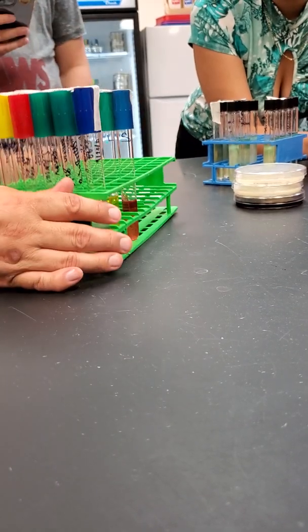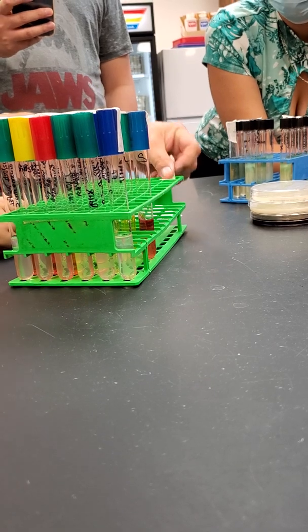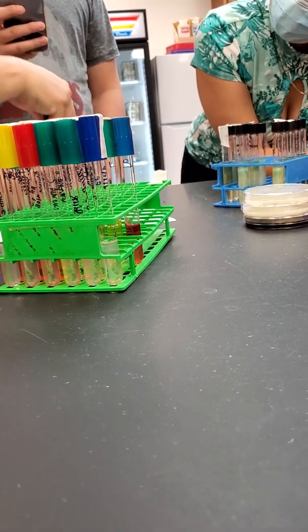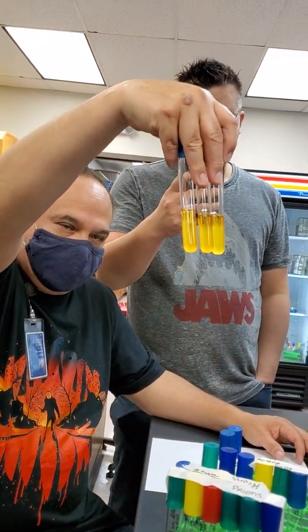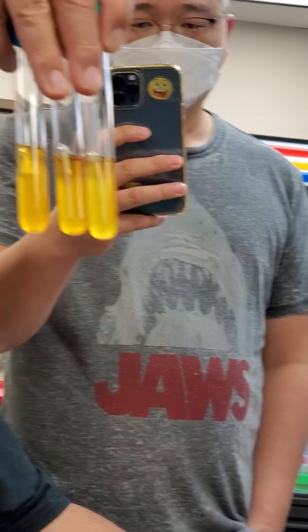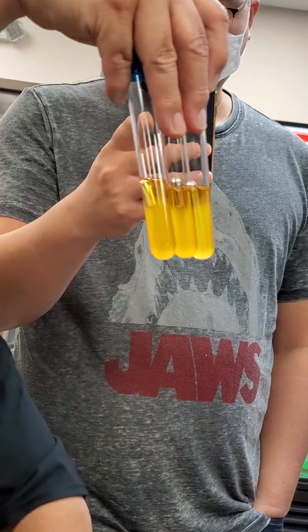All right, so let's talk about these guys. So let's do the carbohydrate fermentation test. Can you all appreciate that on this one, the organism is fermentative in every single nutrient? How do you know it's fermentative? Because it changed to yellow and it has gas in the Durham tube.